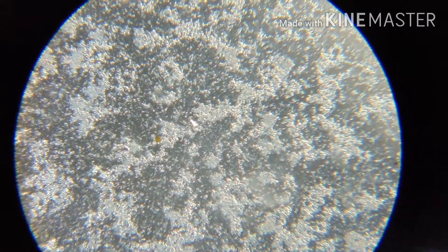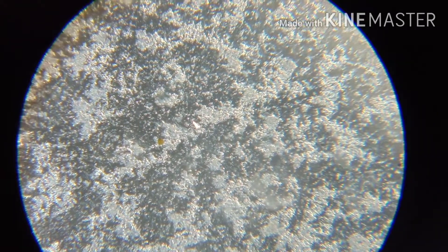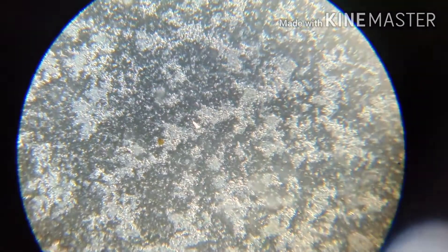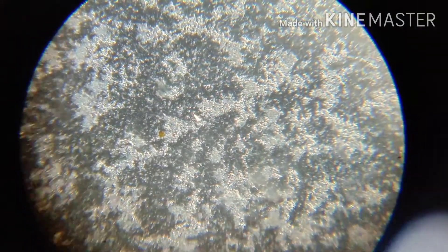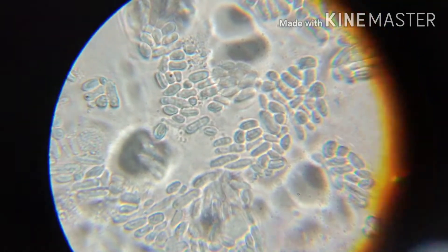The concentration is way up compared to the fresh curd I showed before. It's got cloudy because of the protein content, and it also includes the finger-like structures. There are more living microbes — they are more active — and these are the finger-like projections, as seen at thousand times magnification.